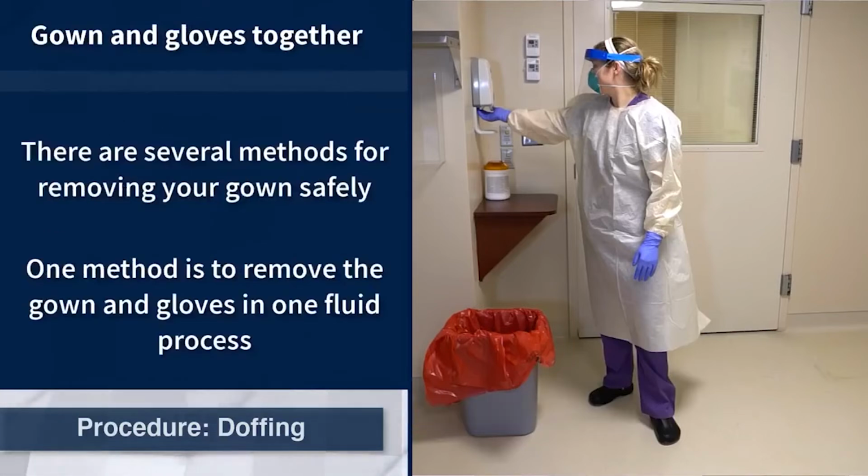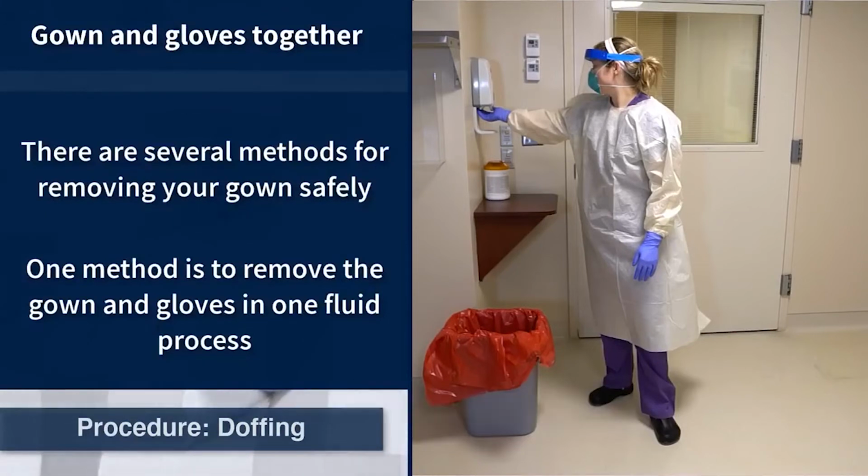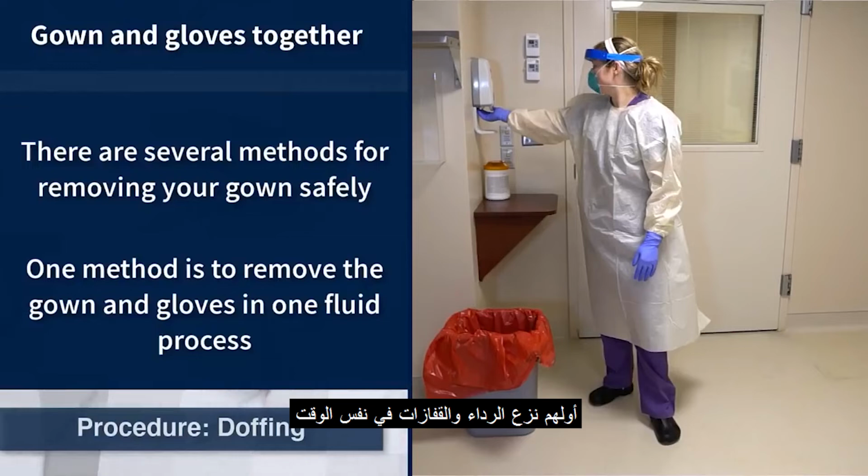There are several methods for the healthcare worker to remove their gowns safely. One is to remove the gown and the gloves in the same process.